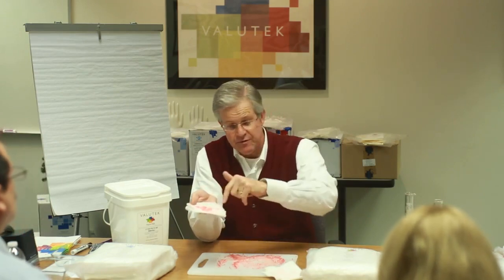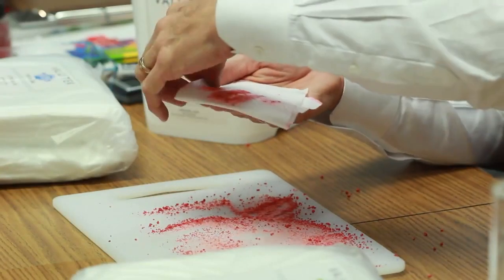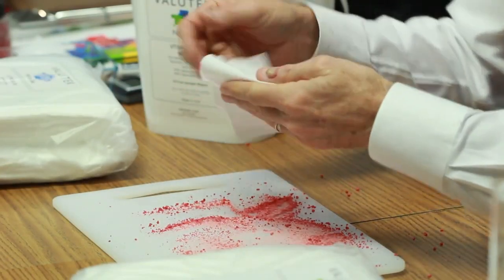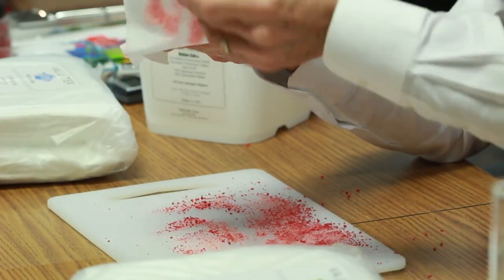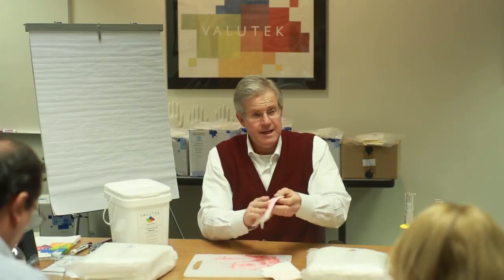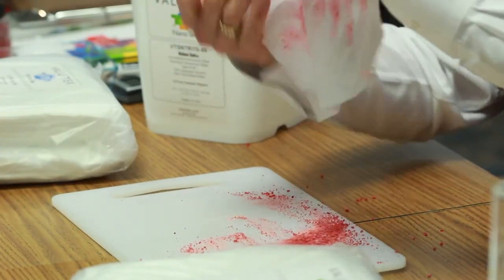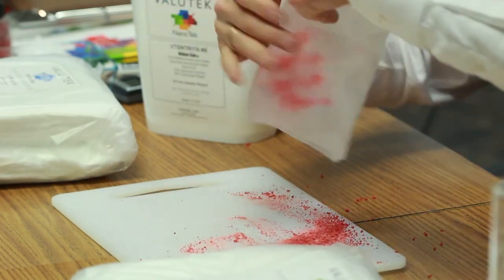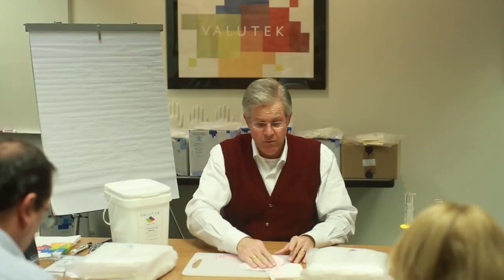Then just one final illustration. One wiper surface should have one wiper pass. So the correct way to wipe a surface clean is I folded it in quarters. So this is one pass. Then I use the back side and I get another pass. Then I take this and I fold it over and I get a third pass, and then I fold it over again and I get a fourth pass. And then if I repeat this with the back side, you actually see that you can get 8 passes with one wiper surface.